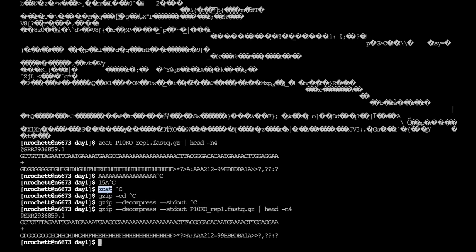One thing you have to know is about zcat on a Mac. Even those of you who are using a Mac, and I'm using a Mac, zcat here is the zcat from the cluster, the normal zcat. On a Mac terminal, if you're just working on your own Mac, zcat is going to be different. You can't use zcat for gzip files. So I just use gzip -cd all the time, because I don't have to think about whether I'm on my Mac or on the cluster. But they're all exactly the same thing.